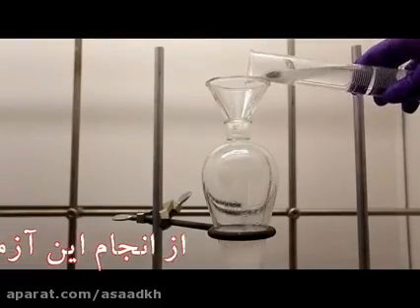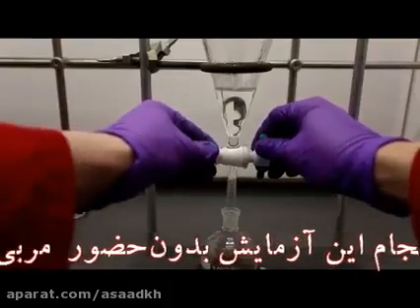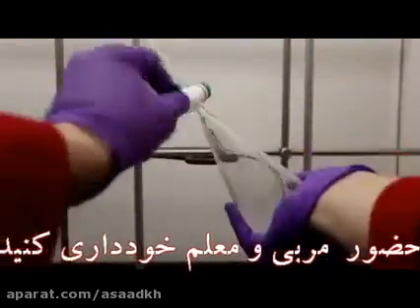Depending on the alcohol chosen to acetylate, the acetylation reaction can lead to very different and distinct smells, such as orange, banana, or even mushroom.